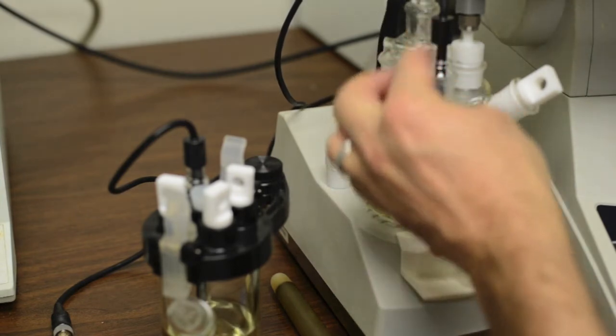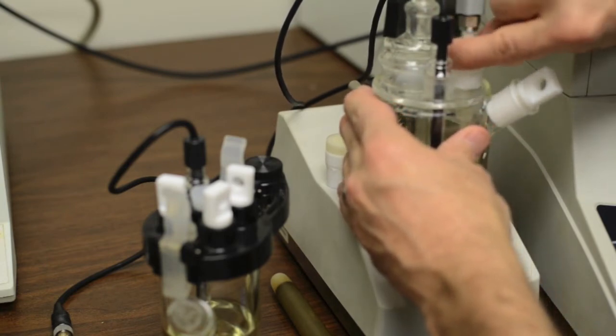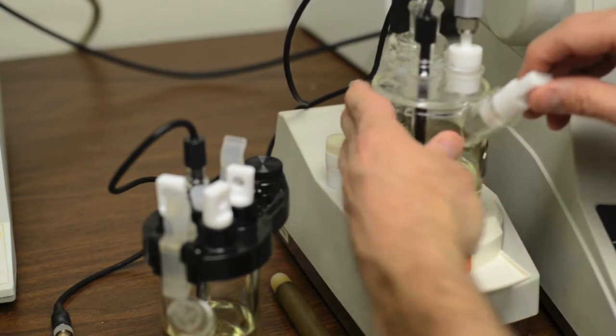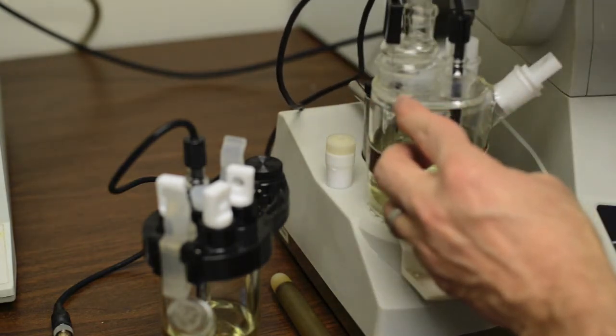That would include a plug, or a detector electrode, or a different device from an evaporator. Anything that sits against this, you'll see, this is a smooth surface, it's smooth, it just sits in there.